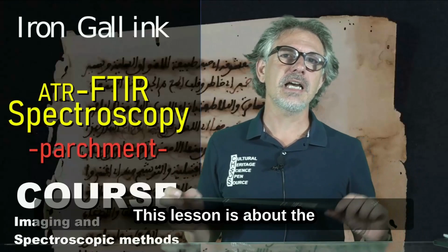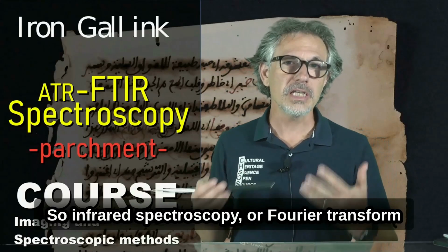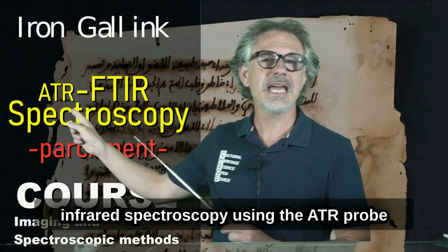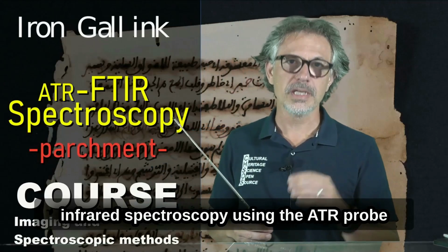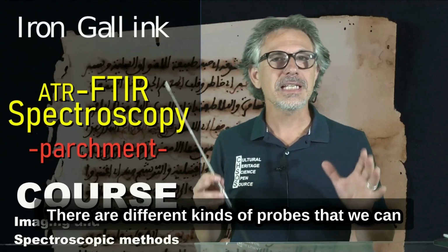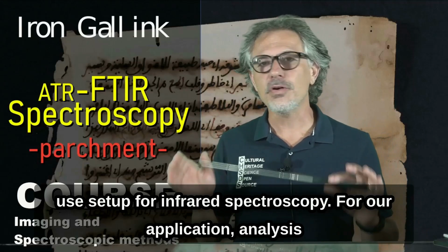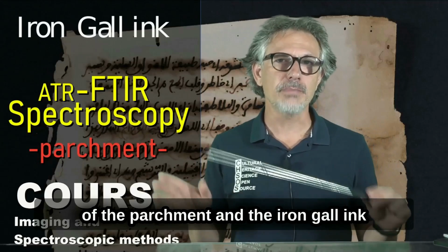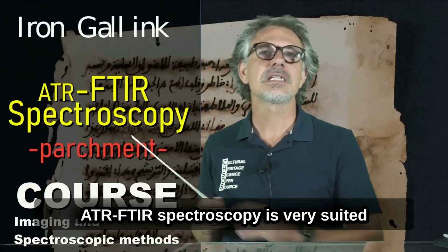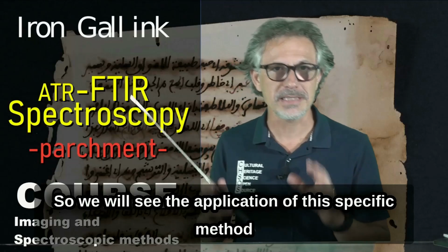This lesson is about the application of FTIR spectroscopy, so infrared spectroscopy or Fourier transform infrared spectroscopy, using the ATR probe. ATR stands for Attenuated Total Reflectance. There are different kinds of probe that we can use and set up for infrared spectroscopy. For our application, analysis of the parchment and the iron gall ink, ATR FTIR spectroscopy is very suited, so we will see the application of this specific method.